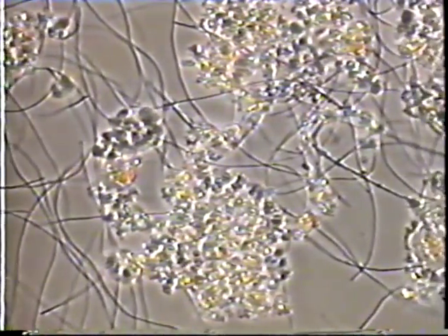Type 021N is a large and long filament that causes significant interfloc bridging. It is the operator's worst nightmare. Type 021N has barrel-shaped cells with clear indentations at the cell walls and no sheath. It is Gram-negative and Neisser-negative.